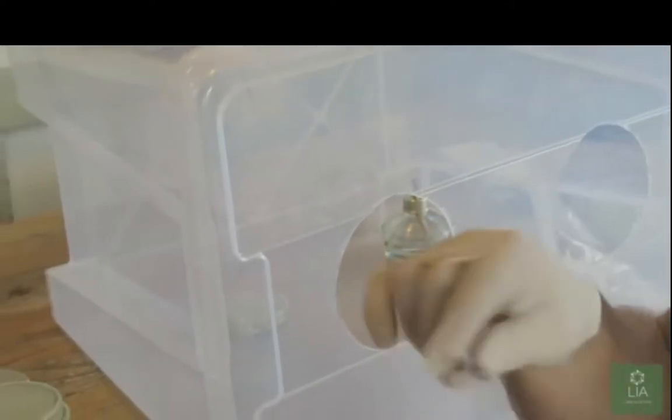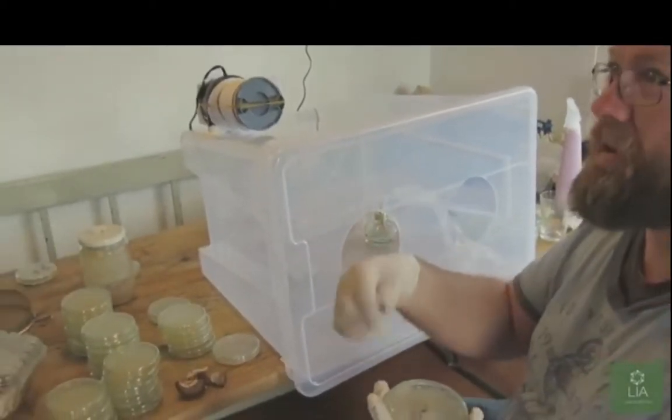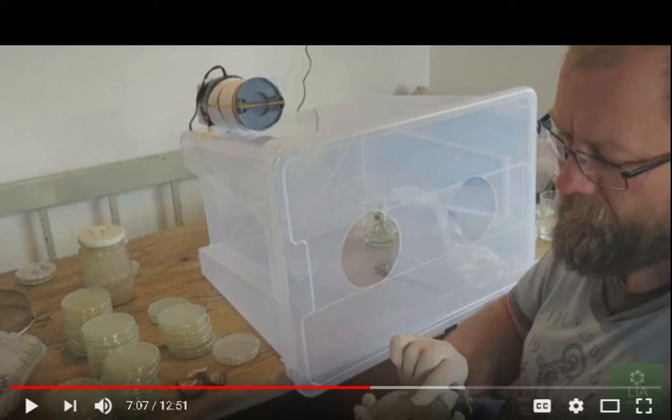You want to slightly tap the mycelium down into the agar when you place it in the petri dish, just so it doesn't have to go searching for food. You want to get it to establish itself as quick as possible. Well, I suppose tapping it down into the dish a little bit, I don't see a problem with that. You just don't want to slam it down into the dish, maybe. I've just seen people just drop the stuff in there and don't touch them at all.